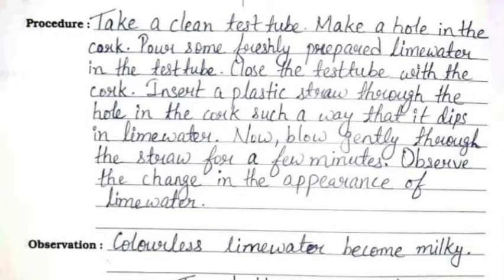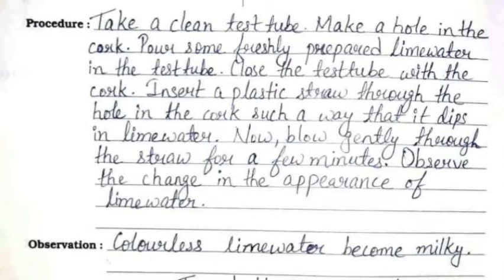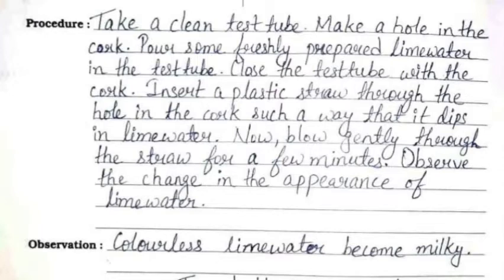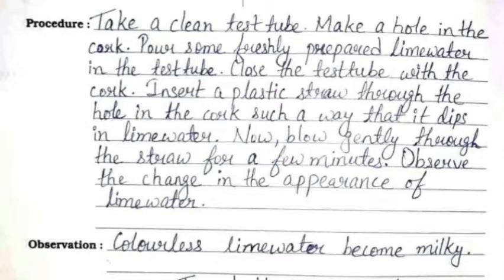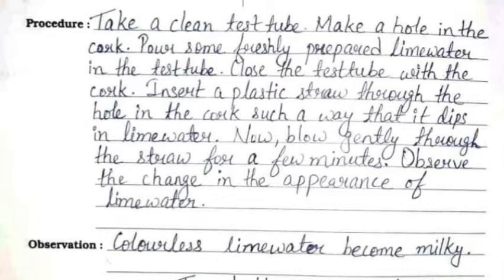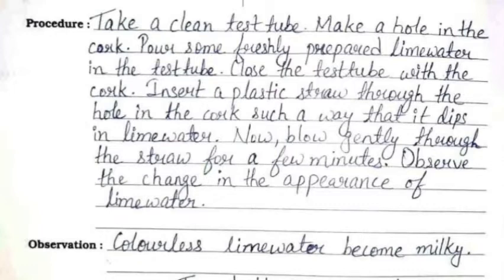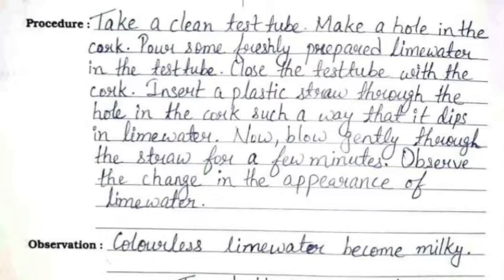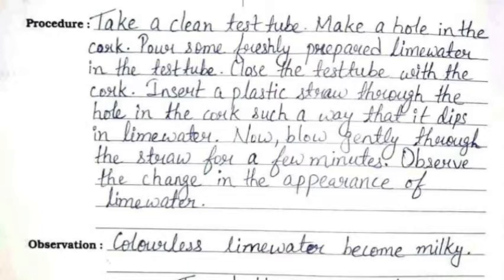The procedure is: take a clean test tube, make a hole in the cork, pour some freshly prepared lime water in the test tube, and close the test tube with the cork. Insert a plastic straw through the hole in the cork in such a way that it dips in the lime water.